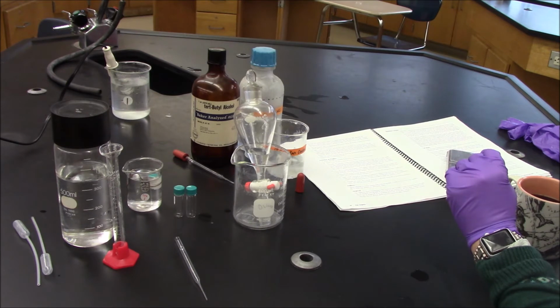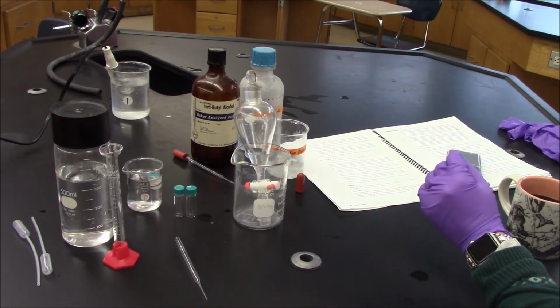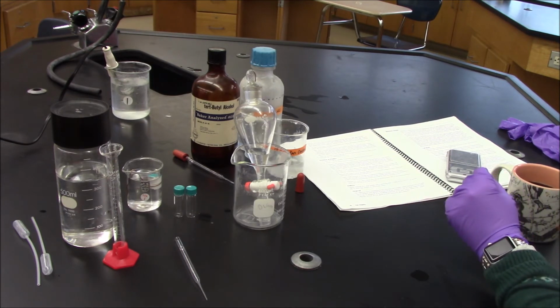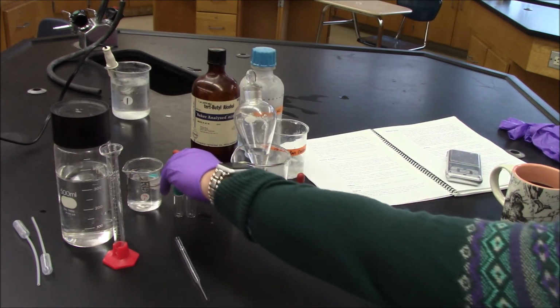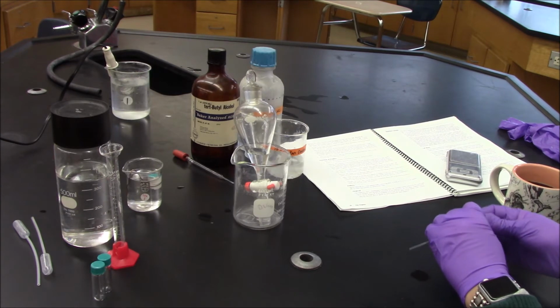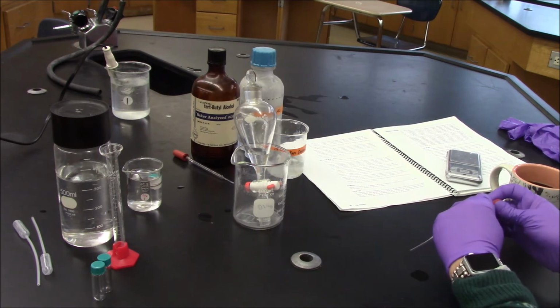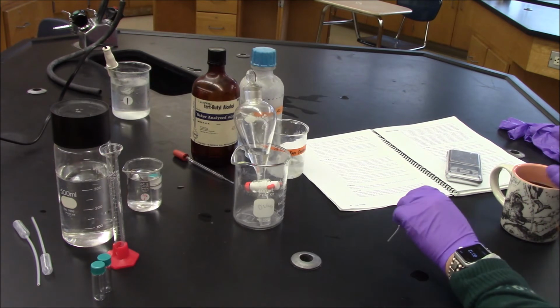Now I say supposedly because I saw lots of bubbles no matter how tightly I capped this, and I even wrapped it in Teflon tape. So I don't know, maybe that'll just be apparent in the end when I do percent yield. But I hope that we got some decent product formation so that we can measure boiling point once we're all done. Okay. Still waiting. About 10 more seconds.